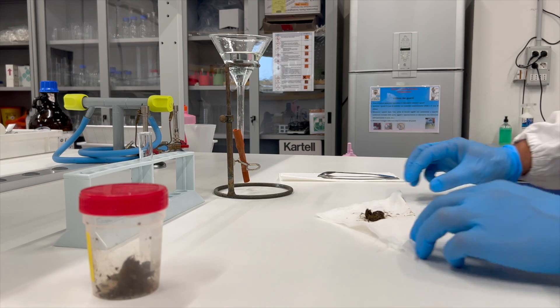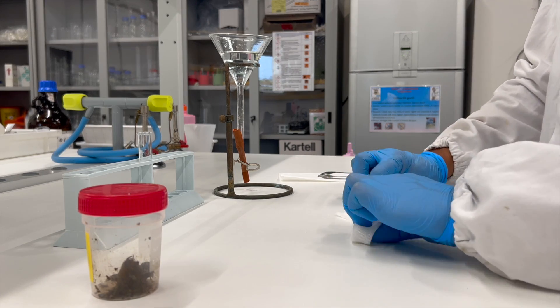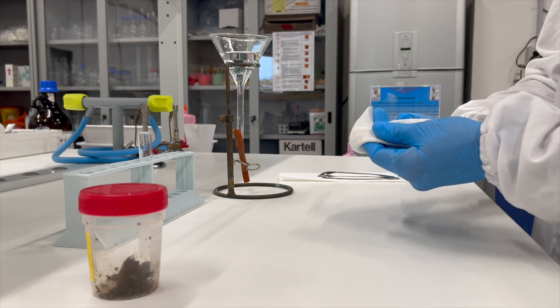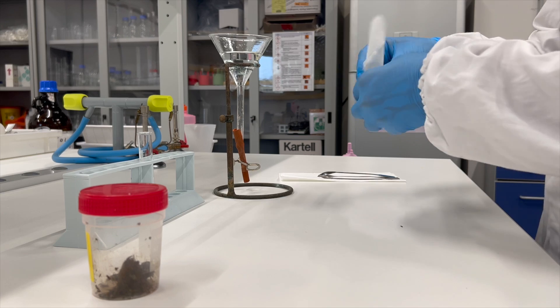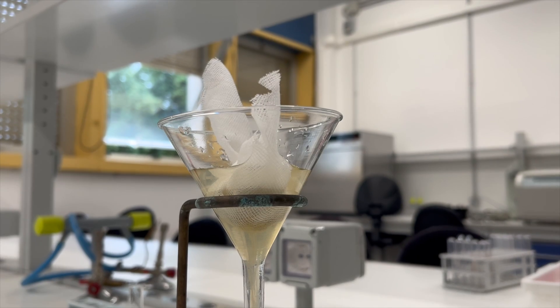Place the fecal sample in the gauze or cheesecloth and secure it by twisting the free ends of the gauze or binding it with a rubber band. Fill a closed-bottom funnel with lukewarm tap water and gently place the wrapped specimen in the upper widened portion of the funnel. Fill the funnel with tap water until the fecal sample is entirely submerged.